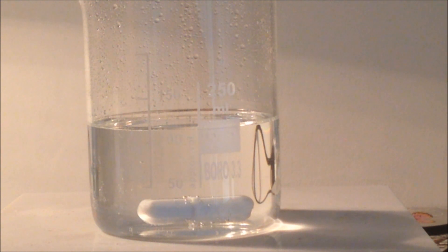I forgot what we were doing now. Making sodium citrate. Yeah. I'm a great assistant. You are a great assistant.